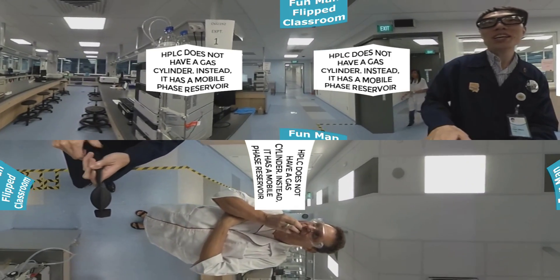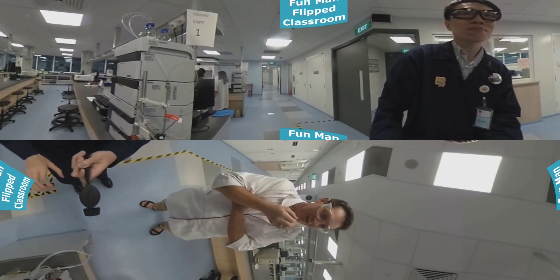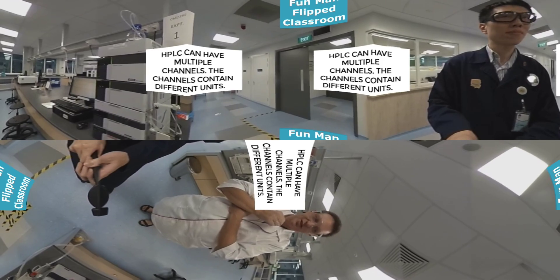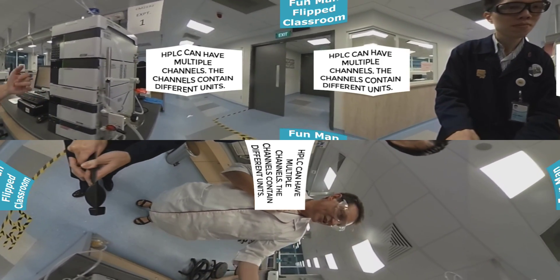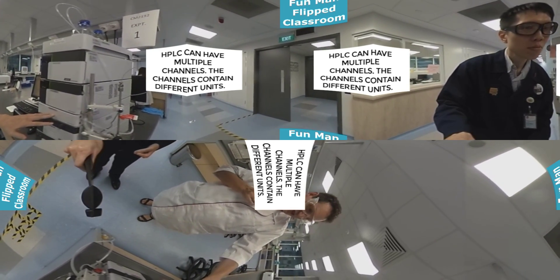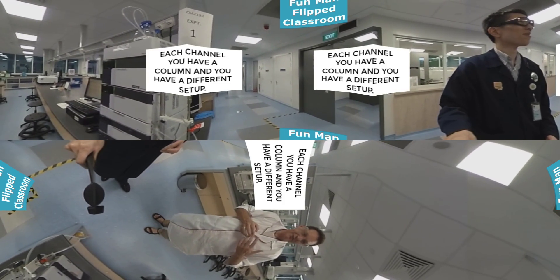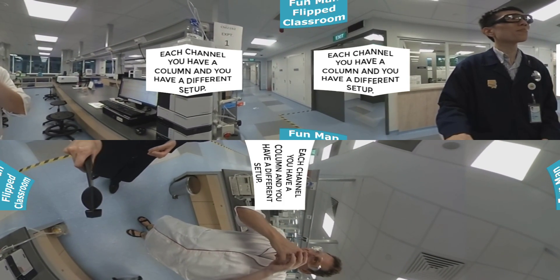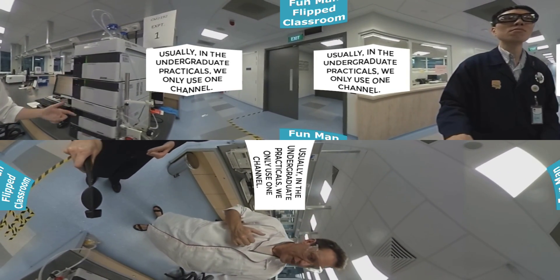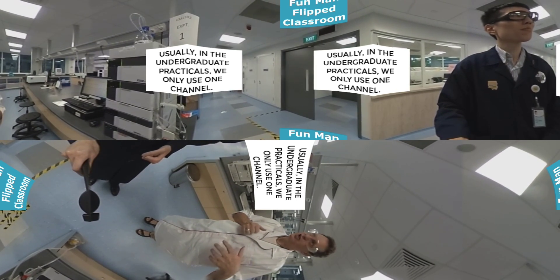Another question one may ask is: why are there so many modules here that look almost identical? HPLCs can have multiple channels. So you've got two pump units, two flow units, and that would be the distribution unit. For each channel, you have a column and a different setup. In the undergraduate practicals, we usually use only one channel.